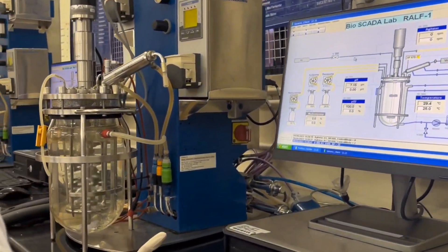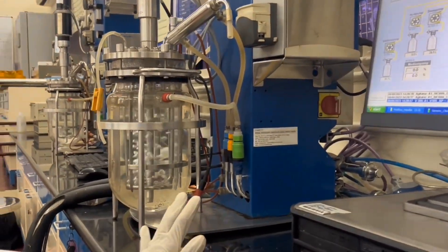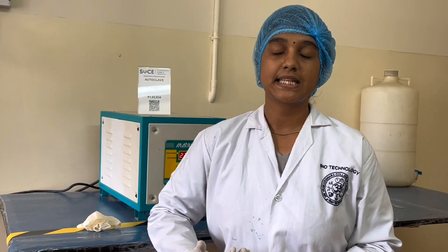I am going to be specifically working with bioreactors for the growth of microorganisms in a sterile and controlled environment.